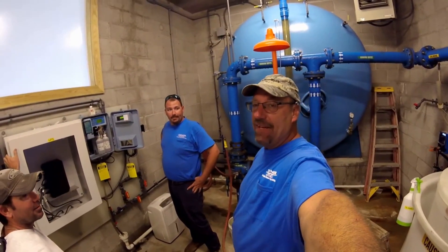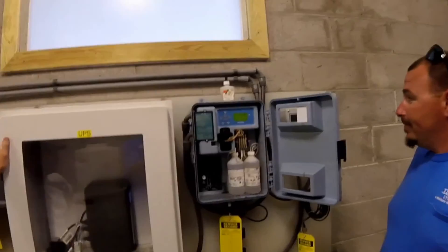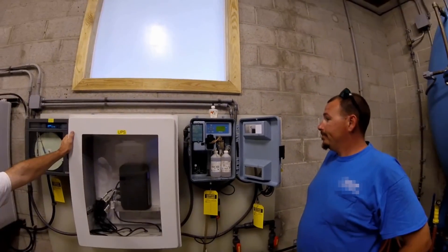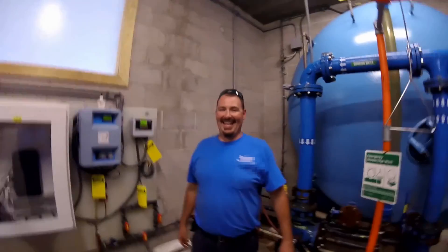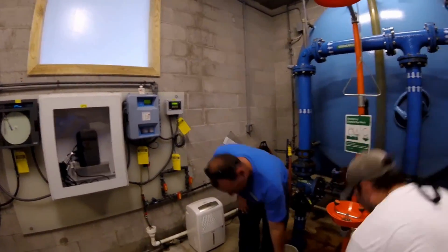I believe we're up and running — just a matter of time. All right, guys, ZC TV is now officially completed. Good job, guys. Thank you. As you can see, we have a chlorine residual and a reading. We did not have that prior to the retrofit, so this job is complete. We can get that buttoned up. I love it when a man follows my commands. Thanks, guys, for a job well done. We'll be right back.